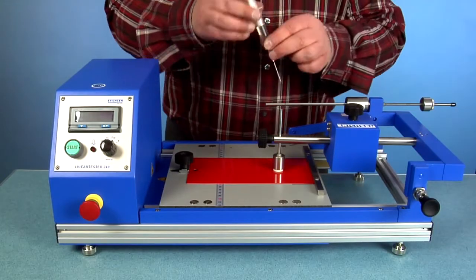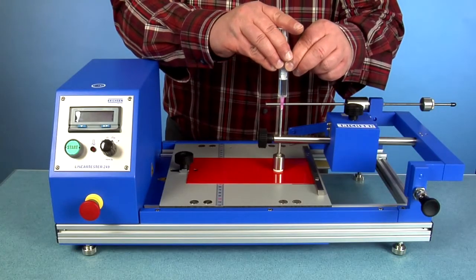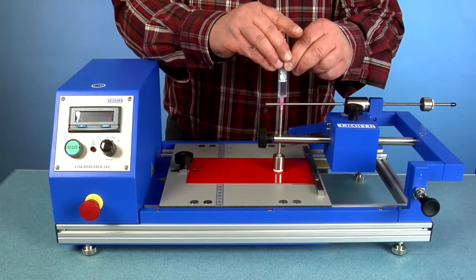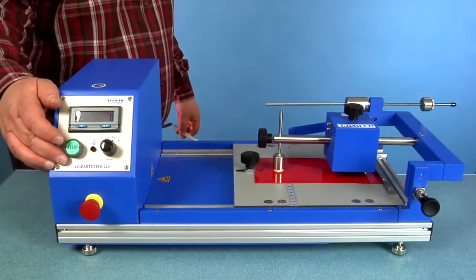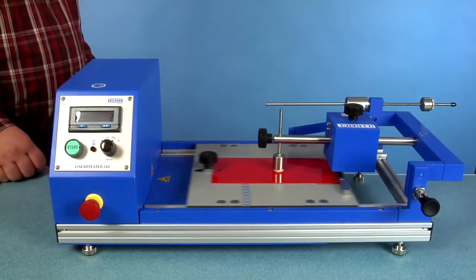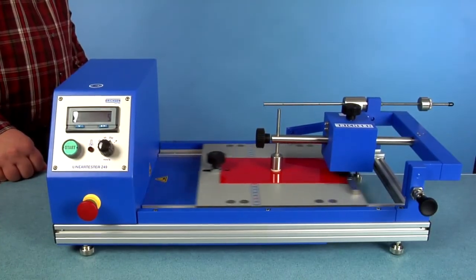The felt plug can be conveniently wet through the shaft. The test begins by pressing the start button and runs until the number of adjusted cycles is fulfilled.